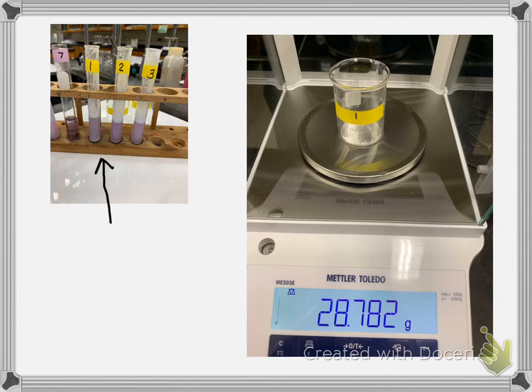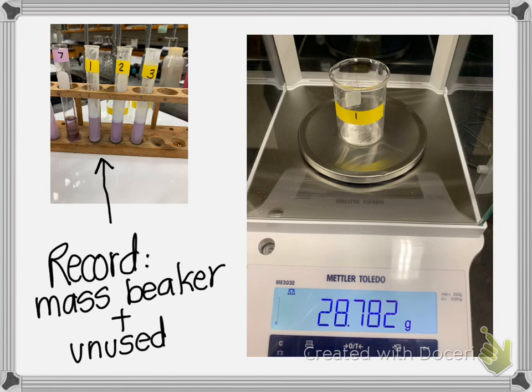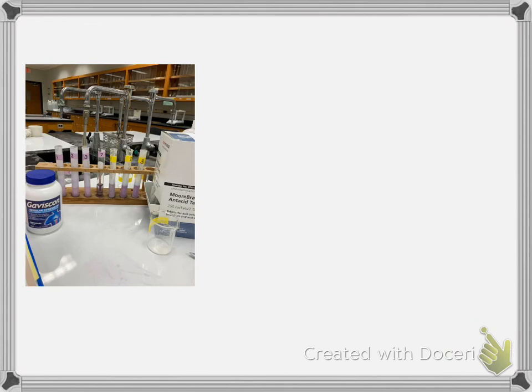And so here, finally, you do need to record the mass of the beaker plus the unused sample. And you can see I hardly had any left. I was glad it came to an end. So there was what I had left with the 2 different samples.